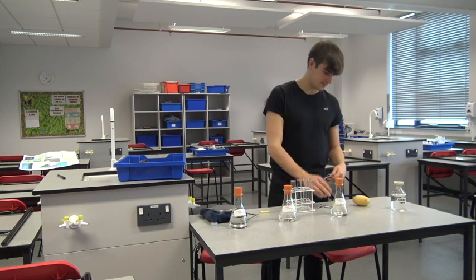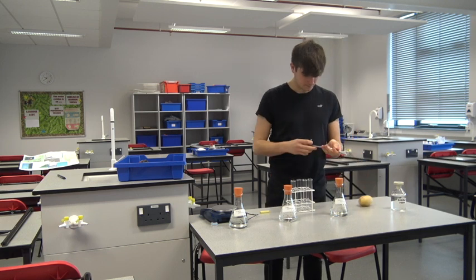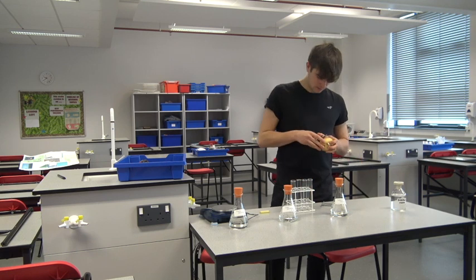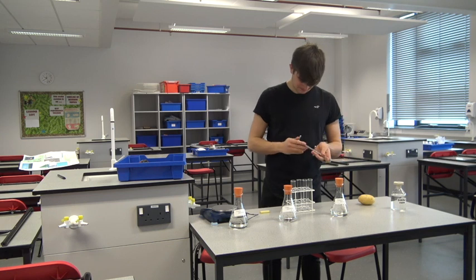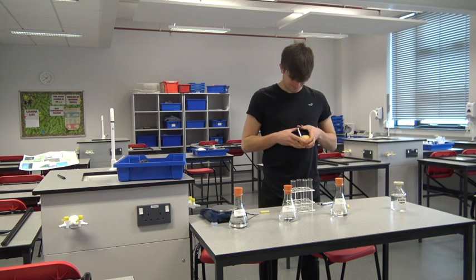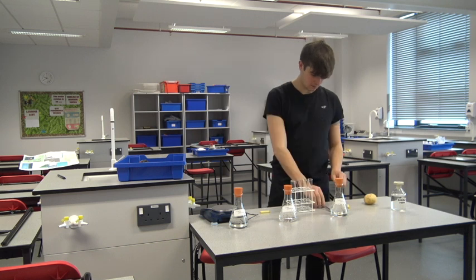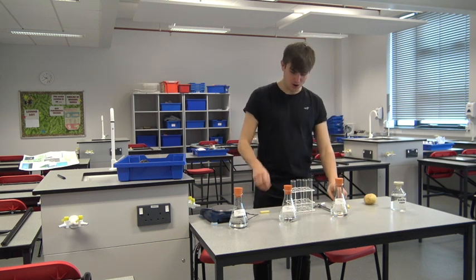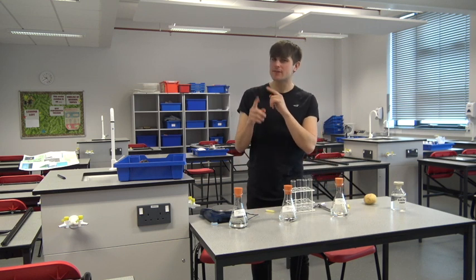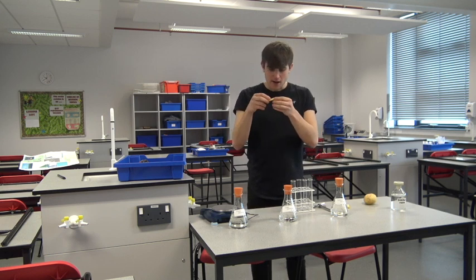I'm going to create four first. Now I've got four equally sized potato chips, but there will be small differences with them. So what I'm going to do is just cut the little bits of the ends off.